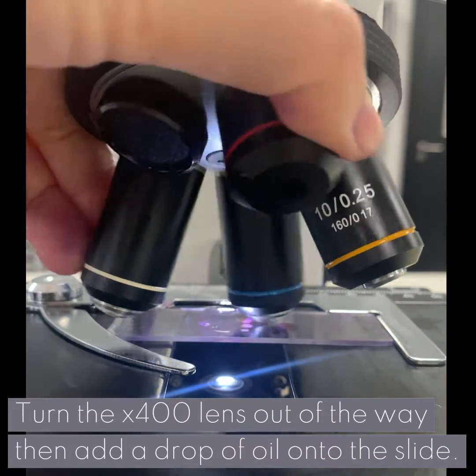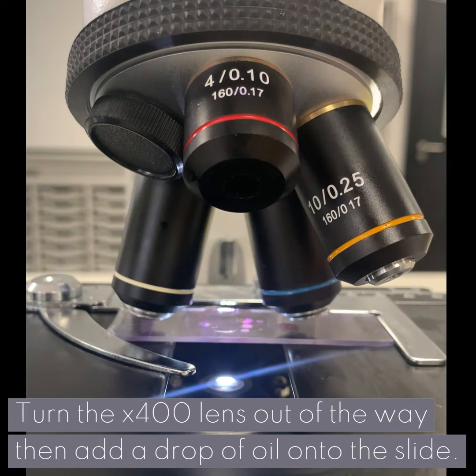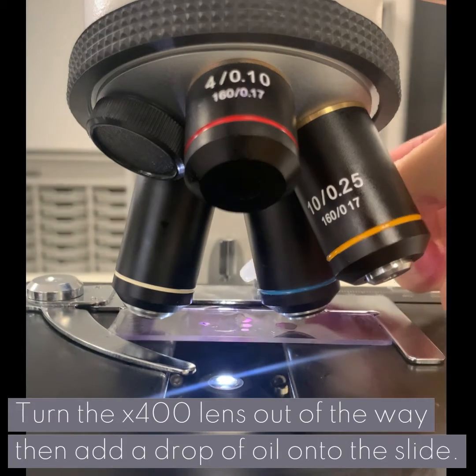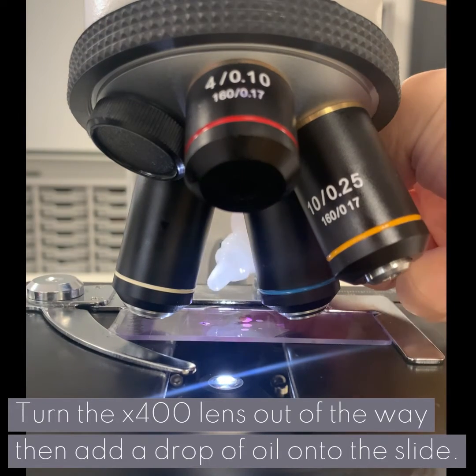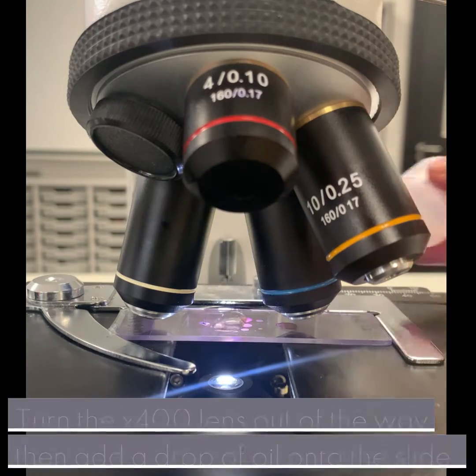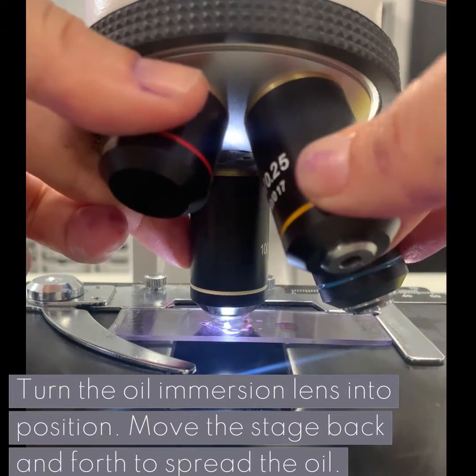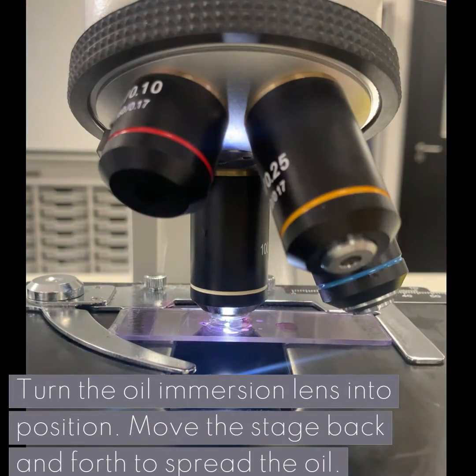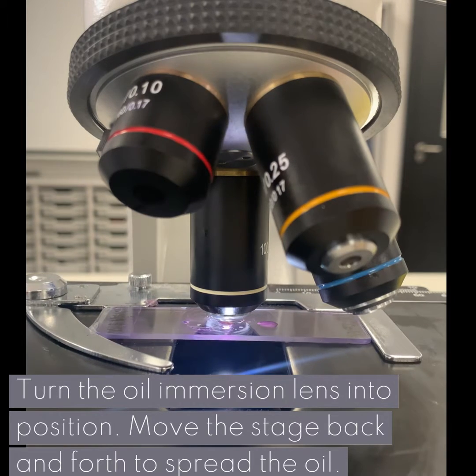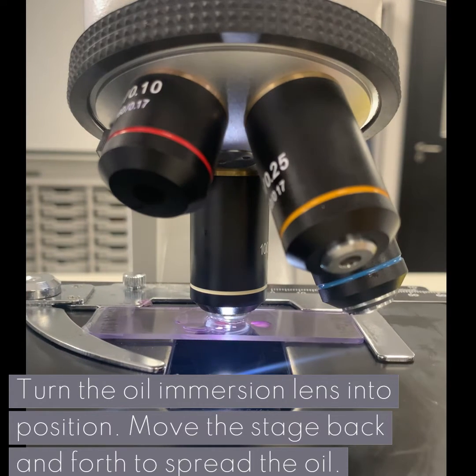Turn the times 400 lens out of the way, then add a drop of oil onto the slide. Turn the oil immersion lens into position. Move the stage back and forth to spread the oil.